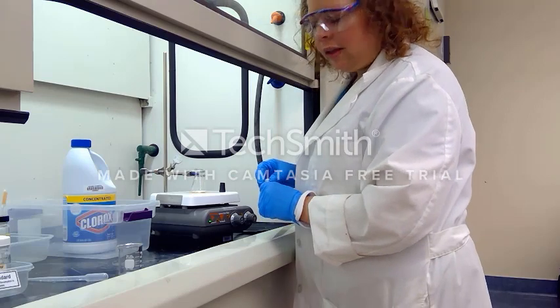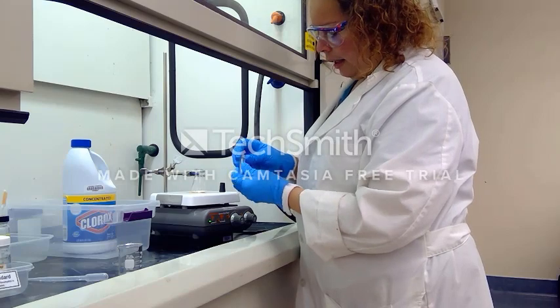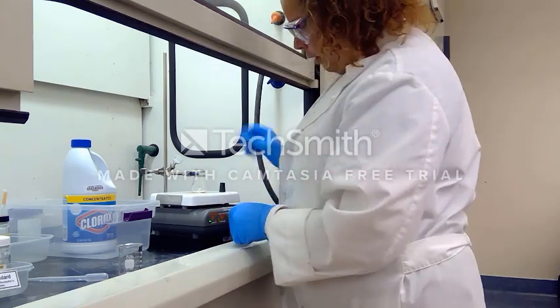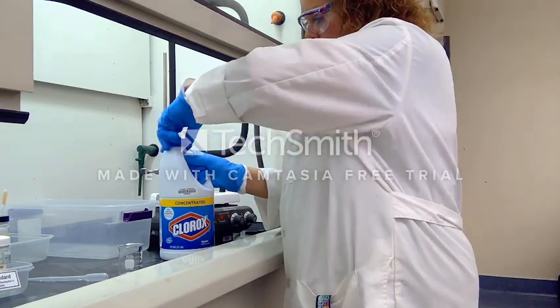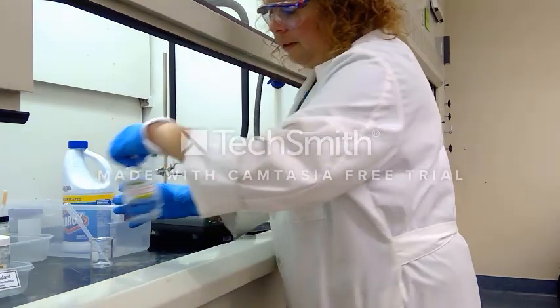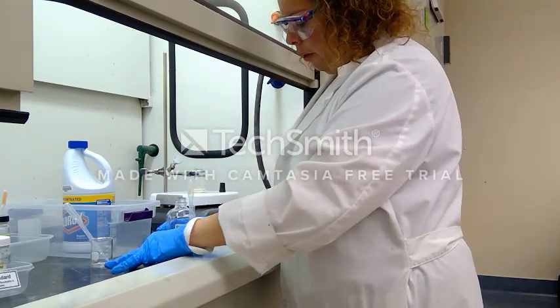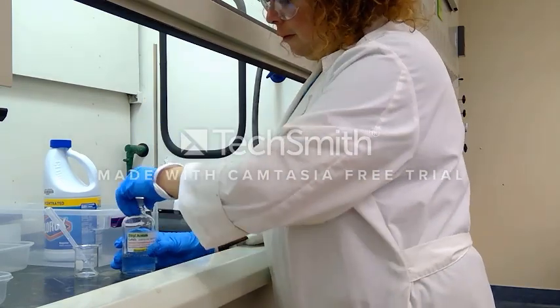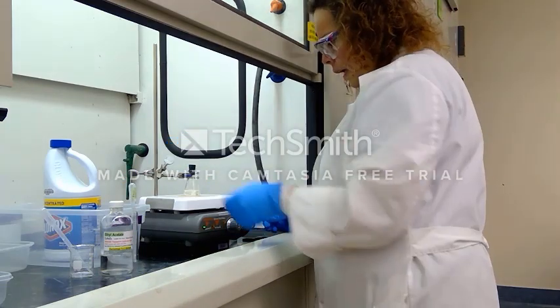I'm adding a stir bar so I can spin my solution. Our oxidizing agent is normal Clorox bleach, so I'm going to pour a little into a beaker and measure out five milliliters to add to the flask. For my solvent I am adding ethyl acetate — also five milliliters. Because we're going to stir this solution at extremely high speeds, I'm going to add a stopper to my Erlenmeyer flask.